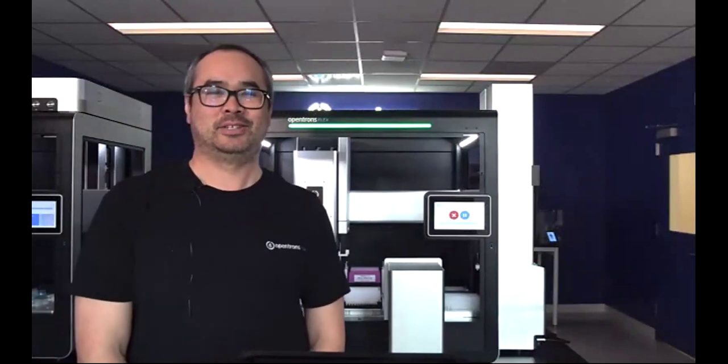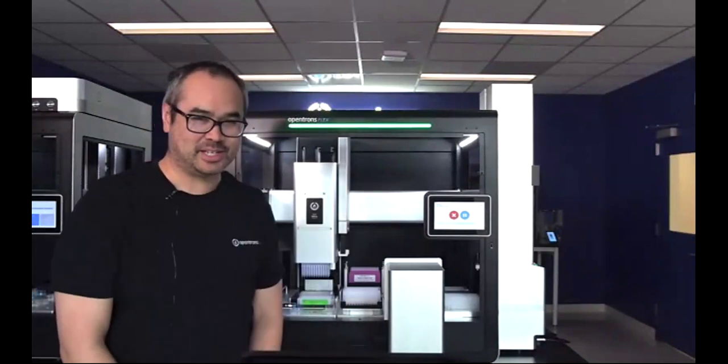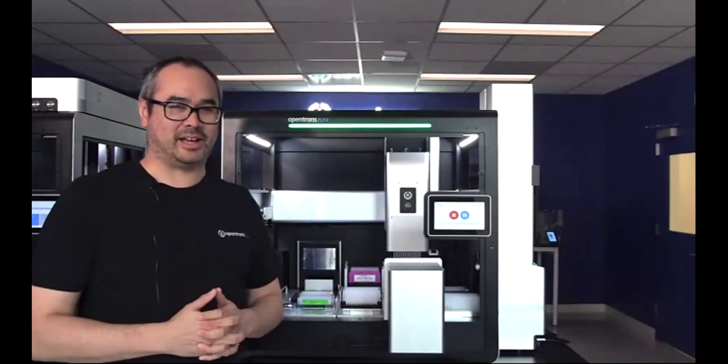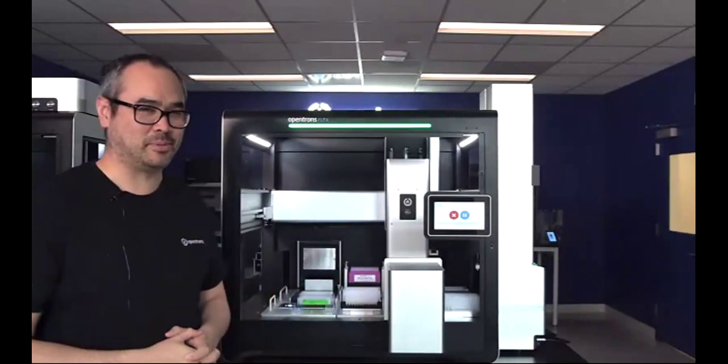Hi, I'm Matt Nakano, Senior NGS Scientist here at Opentrons. So my team develops and tests automated protocols for many popular NGS kits. We carry out a lot of library prep, QC, and sequencing to make sure the protocol is really optimized. So I'm here today to talk about what's being run on the robot. I was there at SLAS. You might have seen our poster.